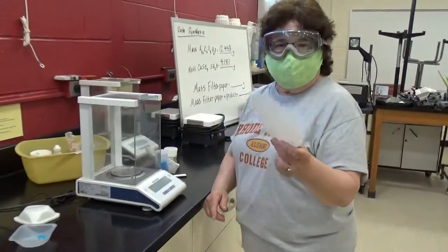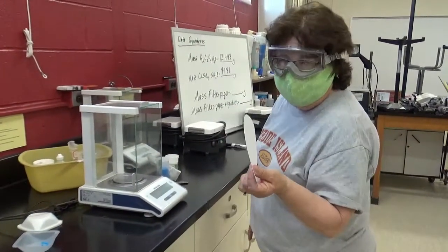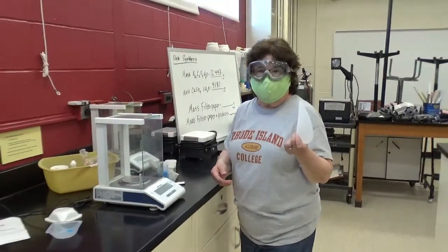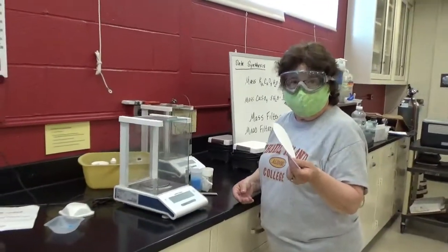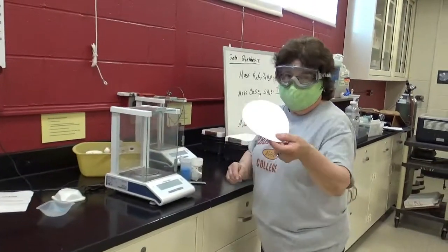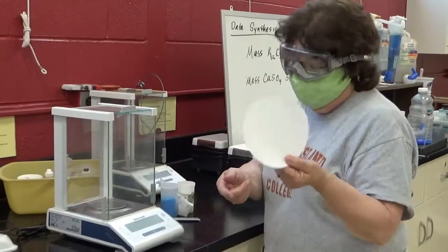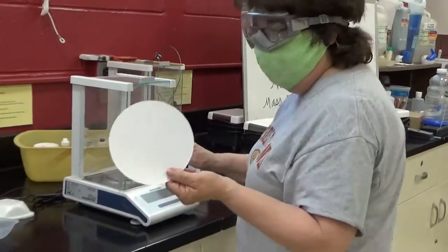Now, we are also asked to measure a piece of filter paper. You might ask why, because the solid that we made that's cooling off right now is going to be filtered, and so it's going to be collected in here, and we want to know how much solid we collected, and we got to know how much filter paper is here to begin with.